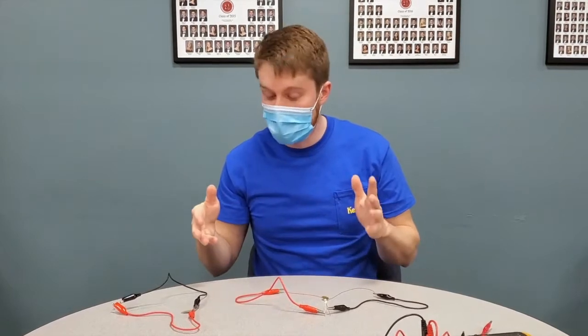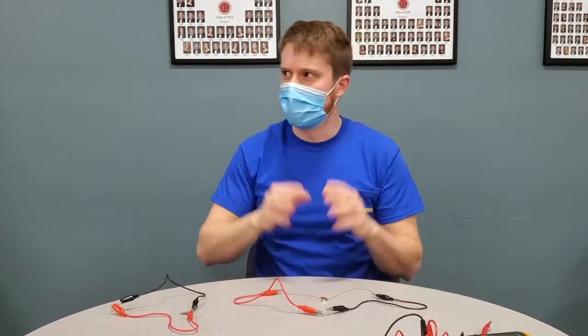So what you actually do is you take a piezoelectric and instead of squishing it to get a voltage, you run a voltage through it, which changes its shape. And that way you can dial in the voltage and get very exact fine movements, which they use for atomic force microscopes and other types of technology like that.